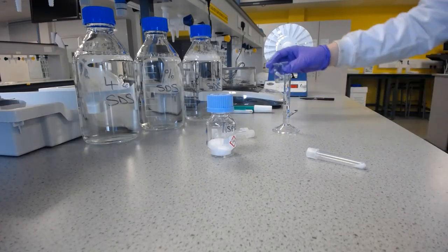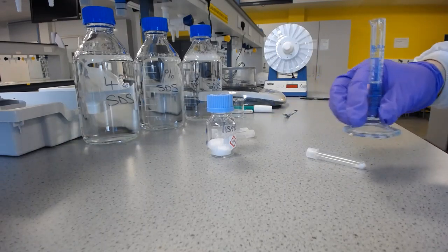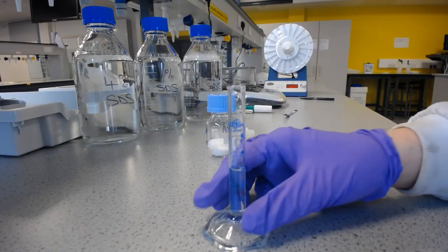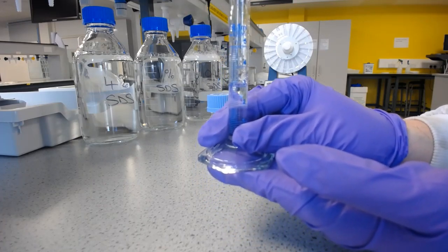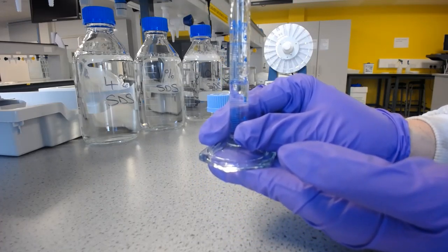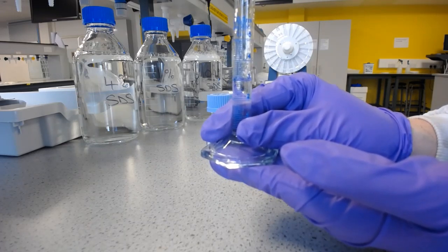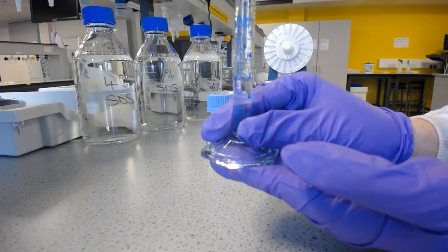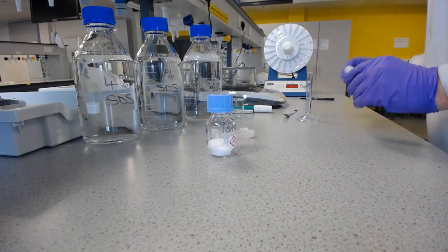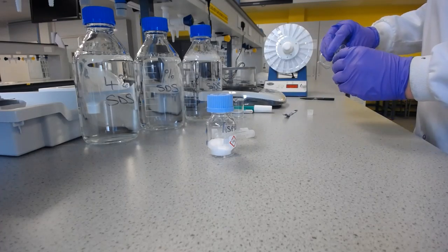That's pretty much perfect. So this is the water that's at 3 millilitres, and if I can get that level roughly with the camera, if I can get it level somewhere, there we are. You should see that the bottom of that meniscus is level with the number 3, indicating I've got 3 millilitres of water in there, which I'll now transfer to the plastic tube.